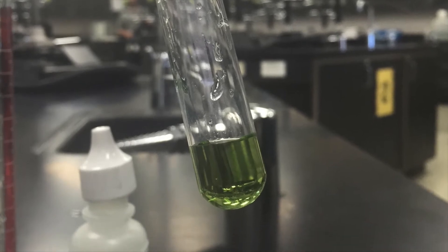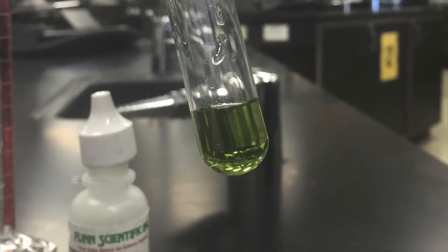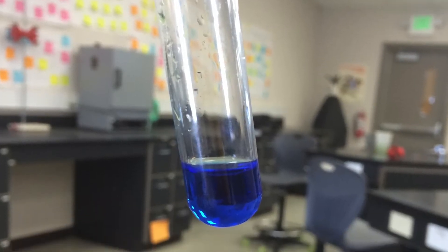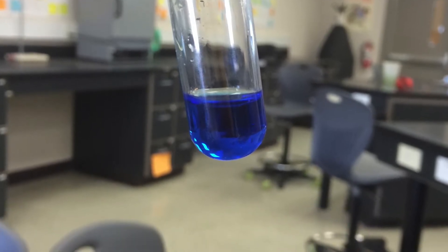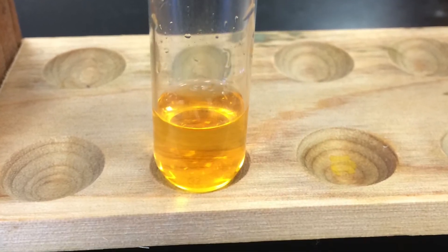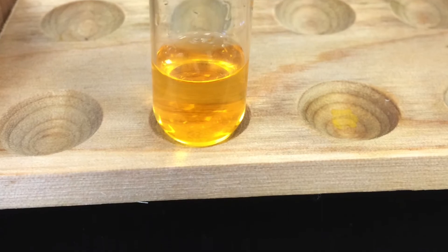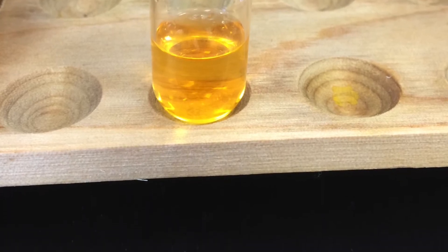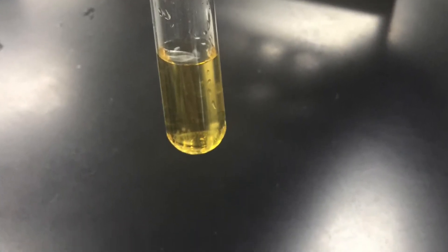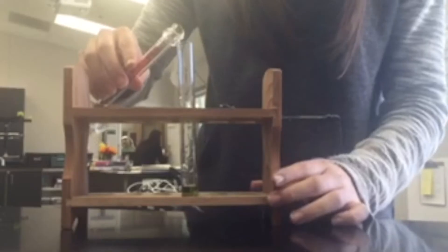The indicator alone is green. When NaOH is added to the indicator alone, the solution is blue. When HCl is added to the indicator alone, the solution is yellow. When both HCl and NaOH were added to the indicator, the solution was still yellow.